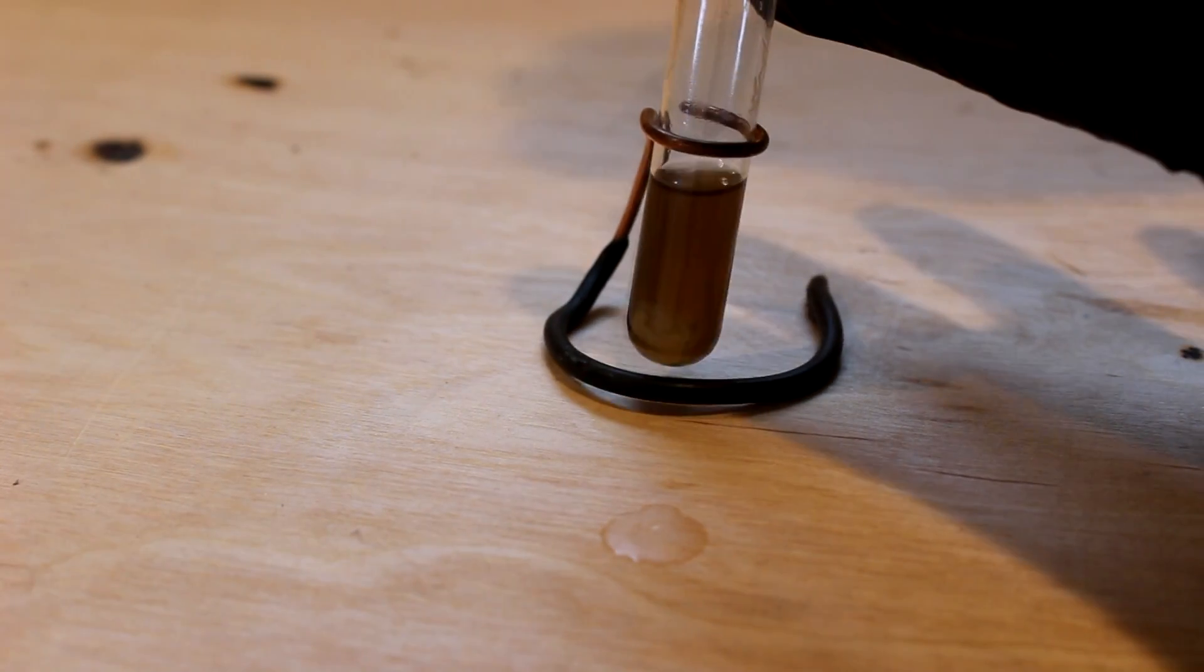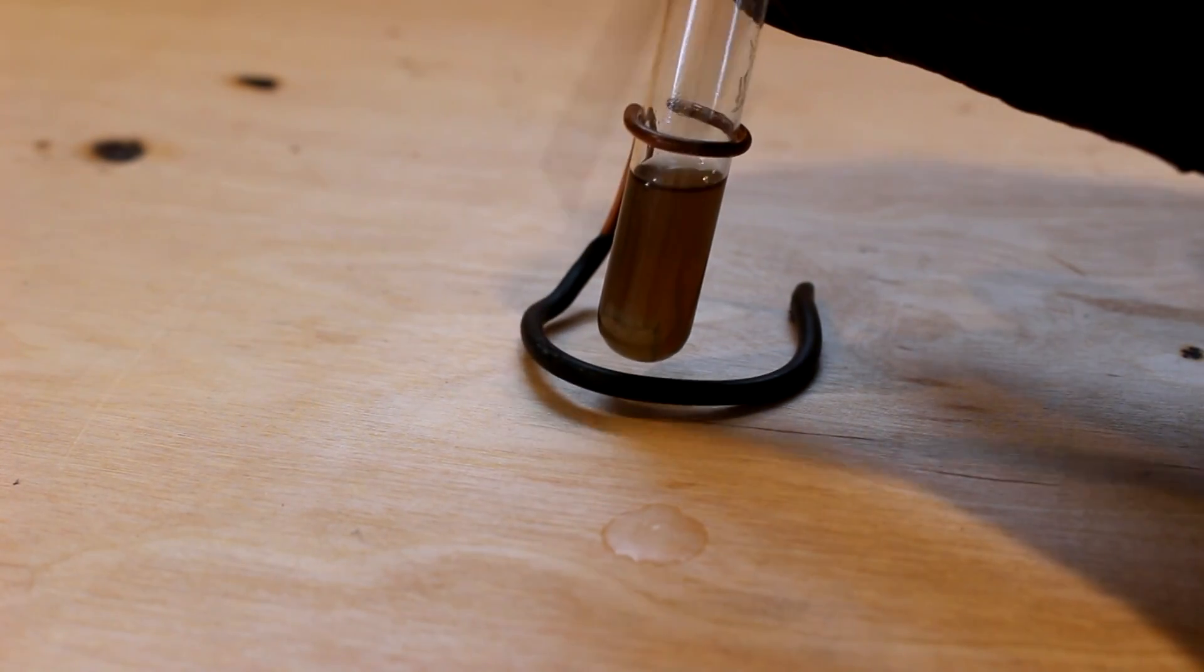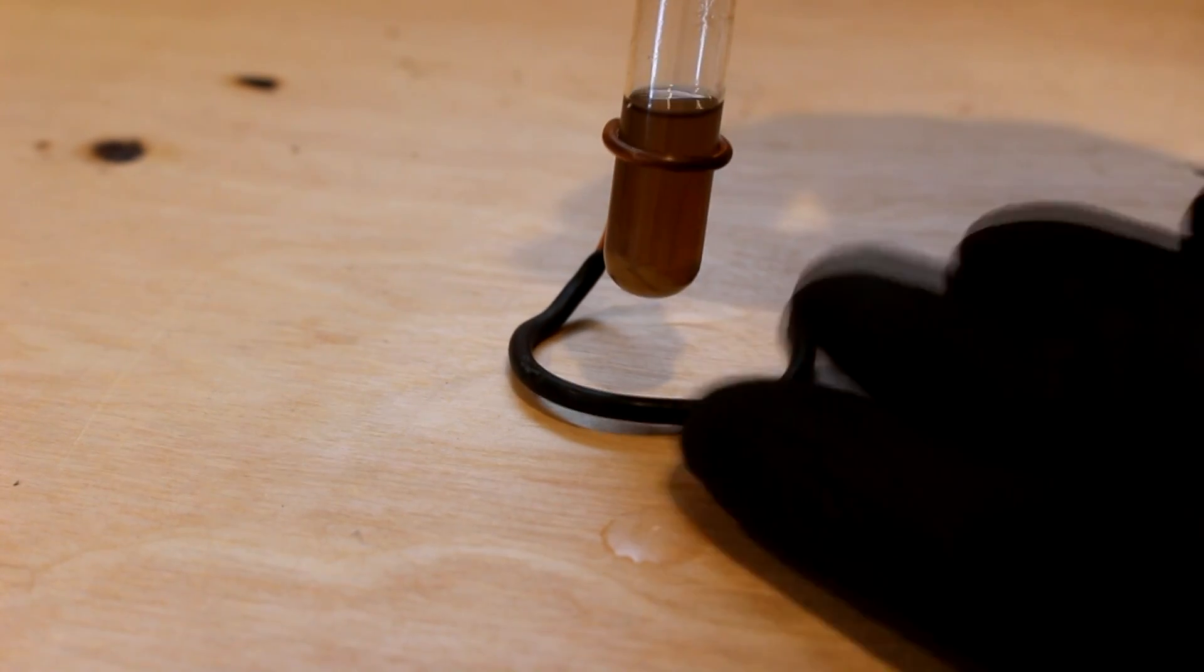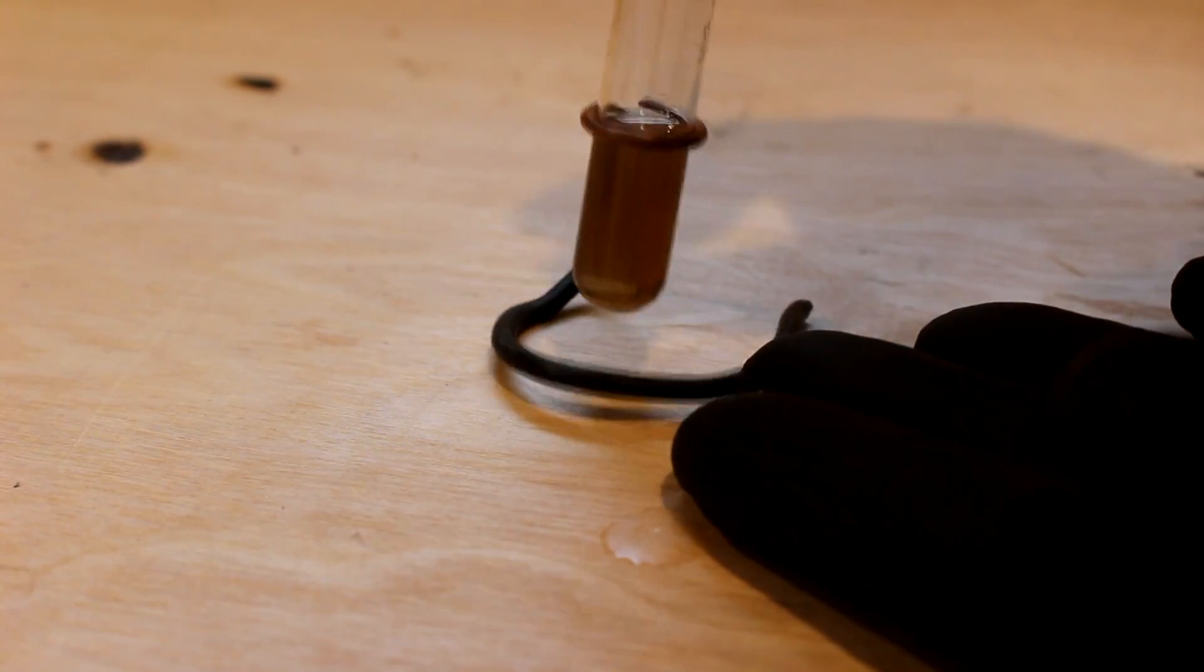I guess I expected that because this solution should have a density of about four and a quarter grams per cubic centimeter. So four and a half obviously sank. But there you go.